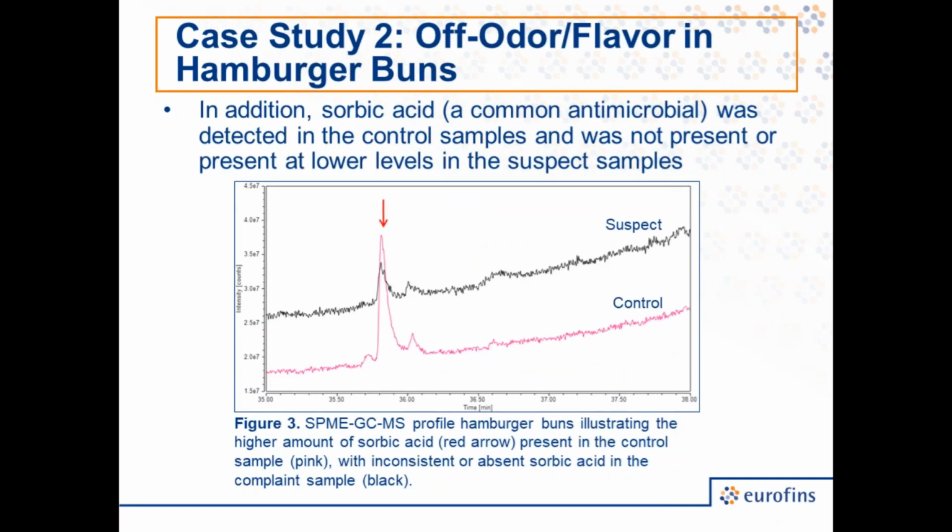However, in addition, we saw something else interesting by this method. So here, once again, I have the profile of the control sample in pink, this time on the bottom, and the suspect sample in black. And what we found in our complaint samples was the absence or a very low level of a peak, which was present in our control samples, which I indicated once again with an arrow. And this compound was identified as sorbic acid, a common antimicrobial.